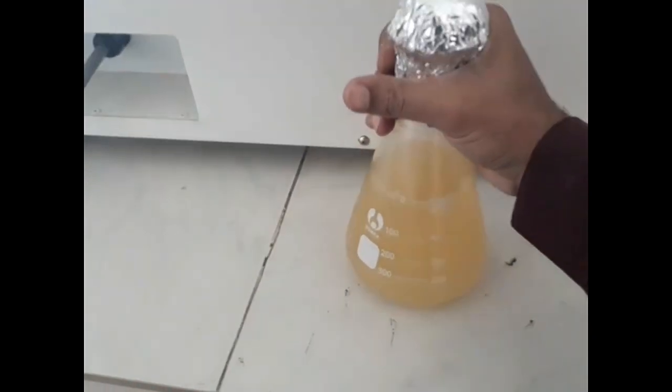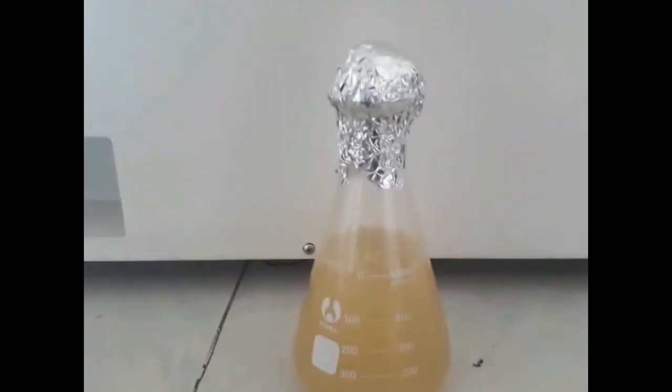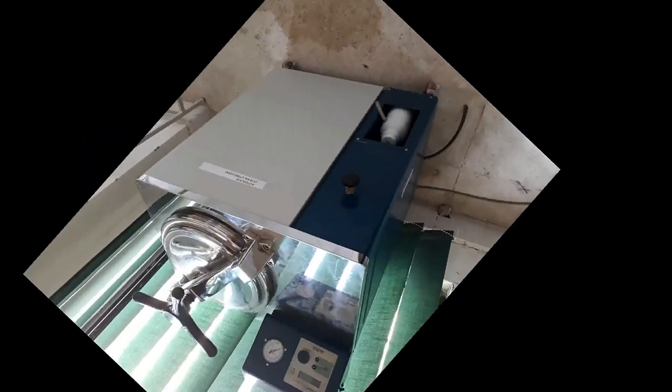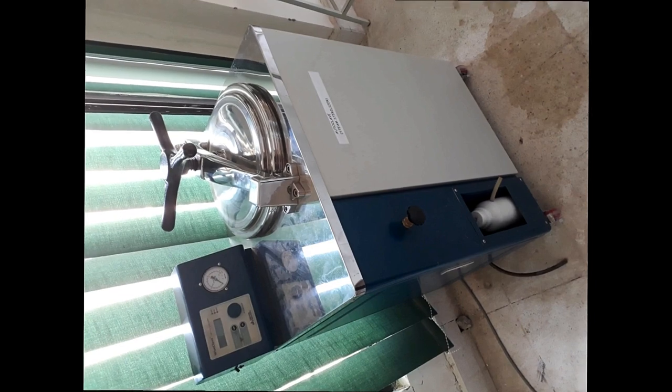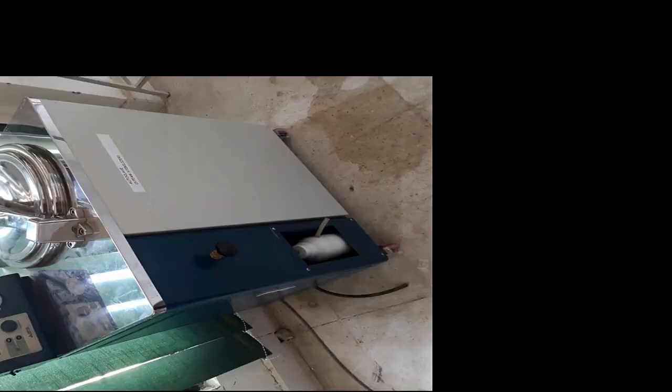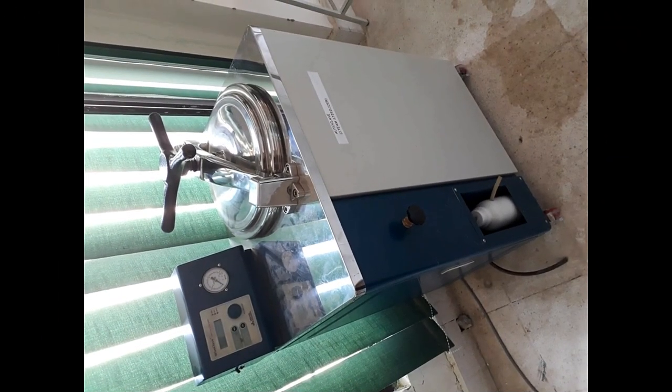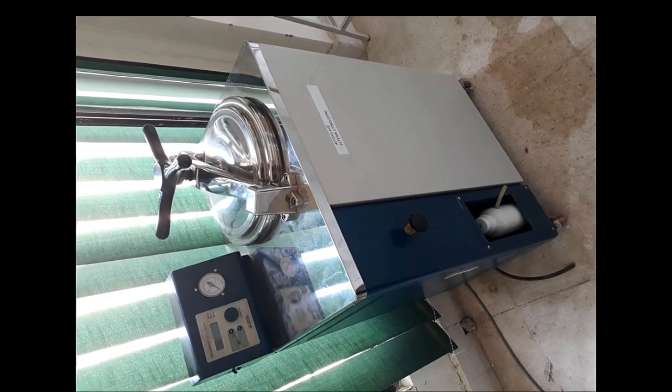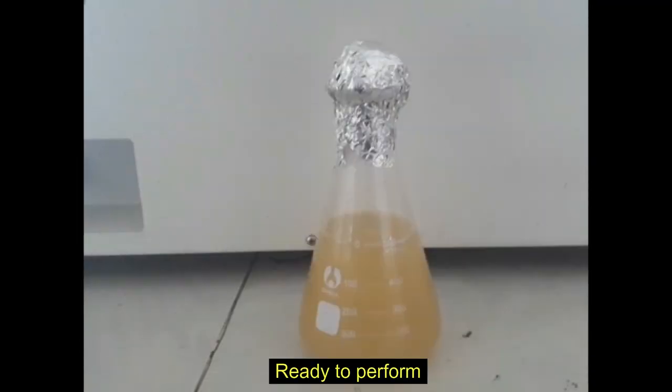Now, PDA is ready to be sterilized in an autoclave at 121 degrees Celsius for 20 minutes. And after that, ready to be used.